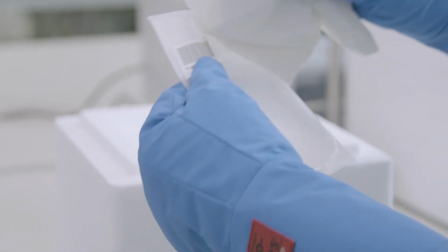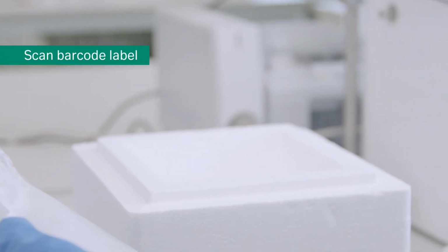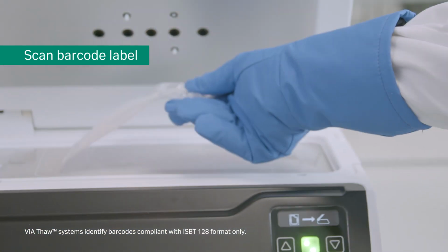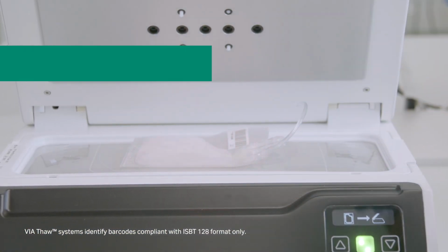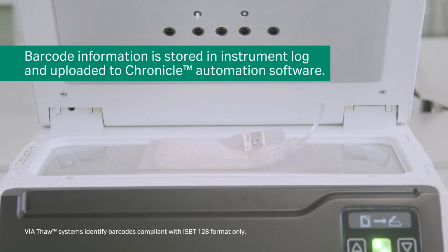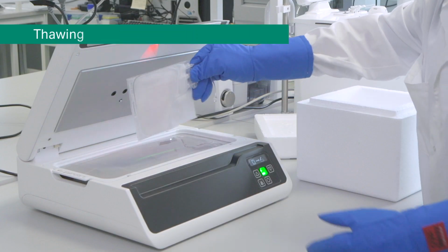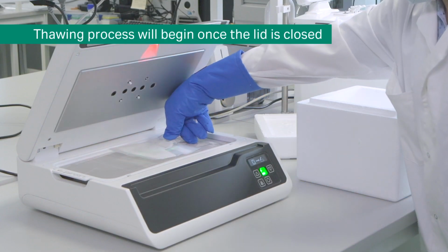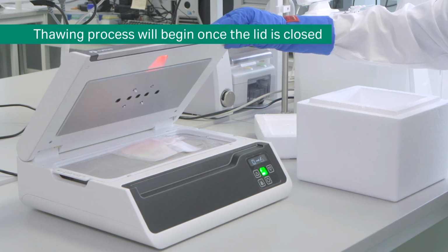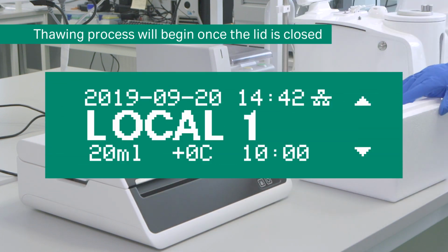If you wish to scan the barcode label, remove any frost, center the barcode under the green strip of light, and, when scanned, the instrument will beep and the barcode reader light turns off. The barcode information is stored in the instrument log and uploaded to Chronicle. If you do not wish to scan, simply close the lid to begin the thaw, ensuring the bag is centered with the label facing down and that the portion of the cryobag containing the sample covers as many of the infrared sensors as possible.